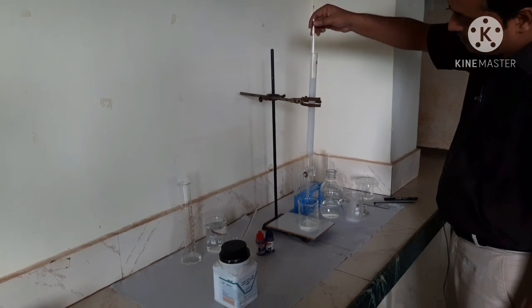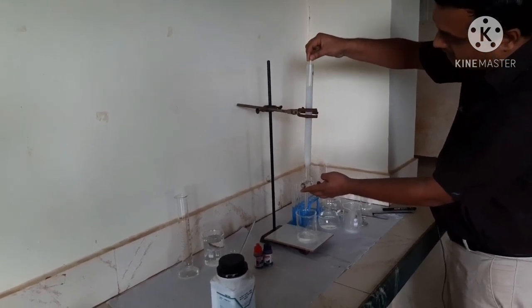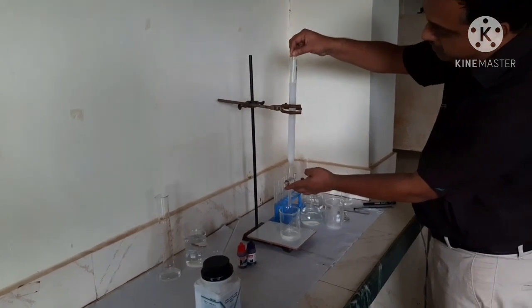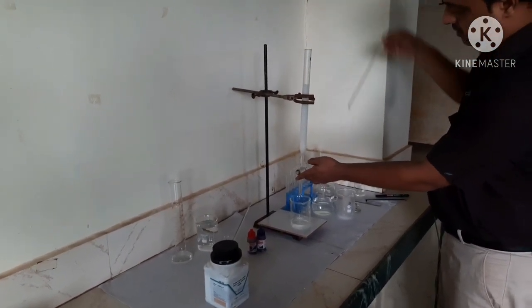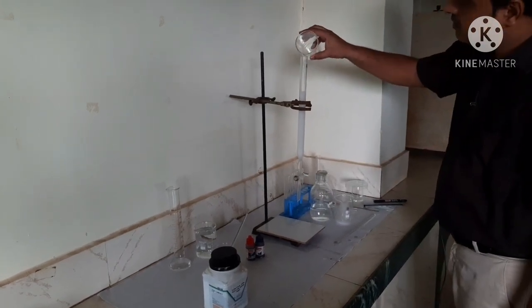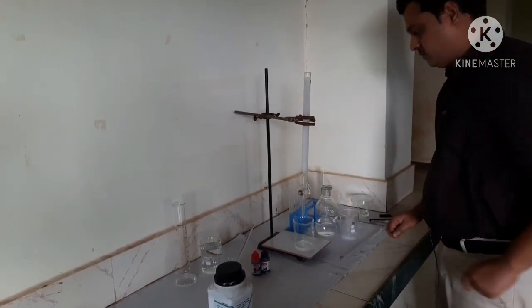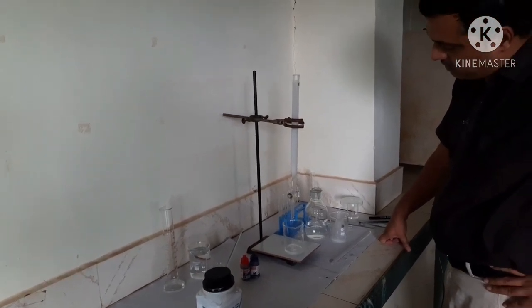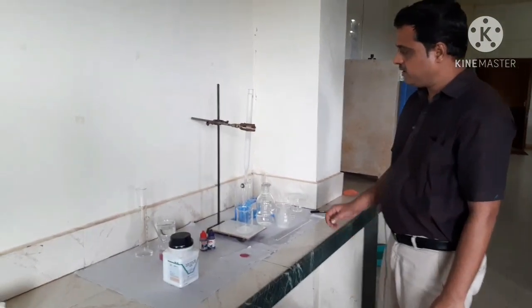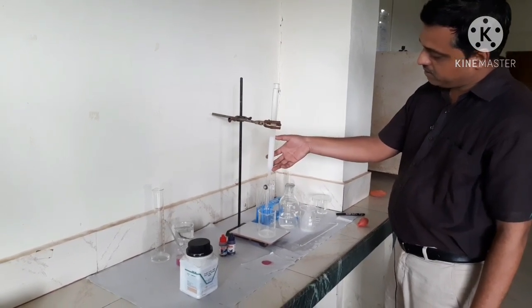Because of the cotton, the silica — the stationary phase — is retained. We then take the longer glass rod and tap the silica slurry so it settles down. This is how we are packing the column. We open the tap and allow it to drip while the silica settles. After about 10 minutes, the silica slurry has settled and our column is now packed.